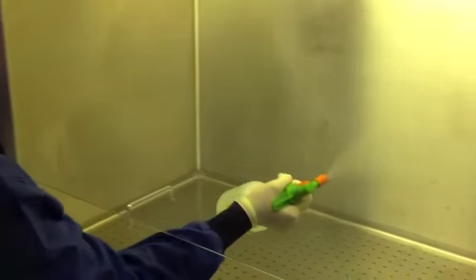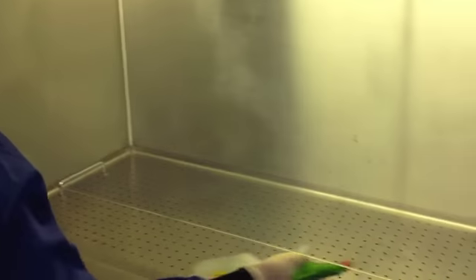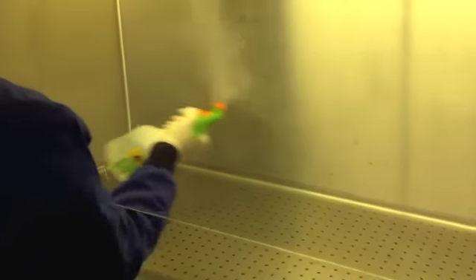Next thing you do is swish the entire contents of the cabinet with 70% ethanol all the way across.